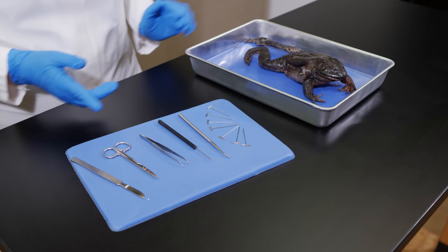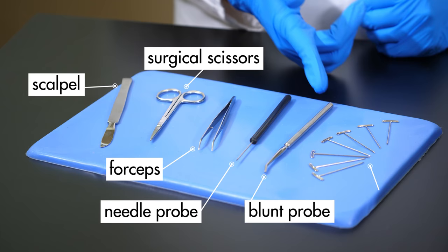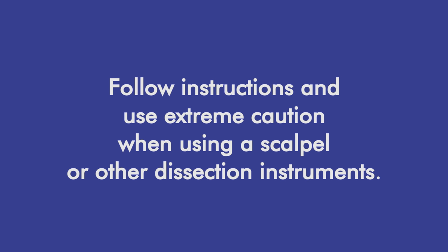A dissection tray, a scalpel, a pair of surgical scissors, a pair of forceps, a needle probe, a blunt probe, and several T-pins. It is important to follow instructions and use extreme caution when using a scalpel or other dissection instruments.